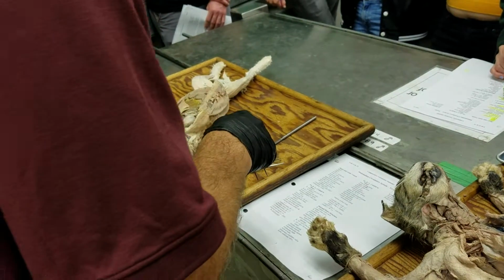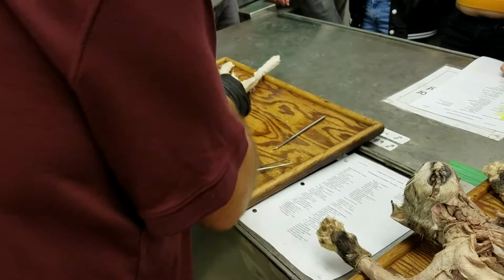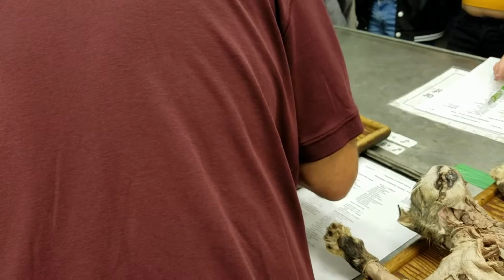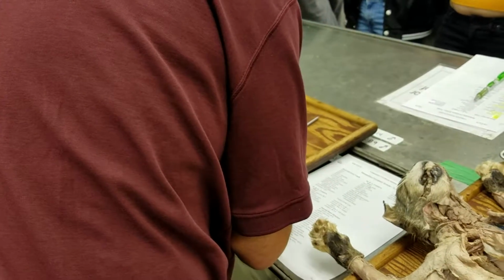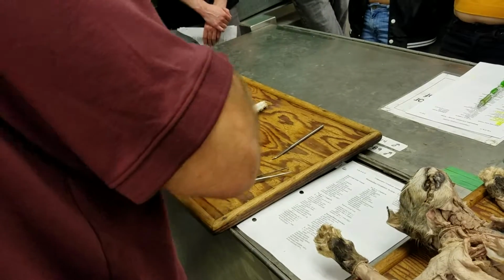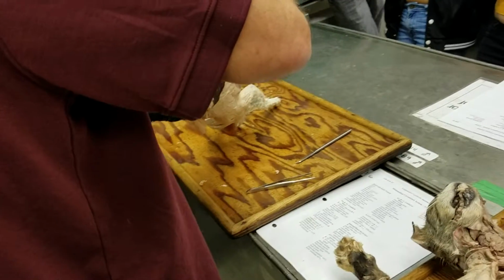All right, and then last but not least, I don't know why I didn't do it when we were already there, but I have pulmonary veins. And you can see pulmonary veins. Just coming back from the lungs to the heart in here, that main connection with the pulmonary veins.